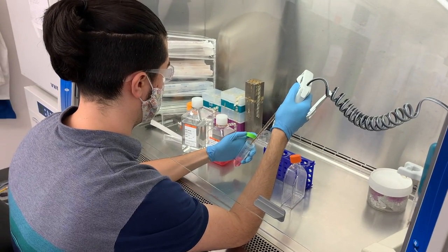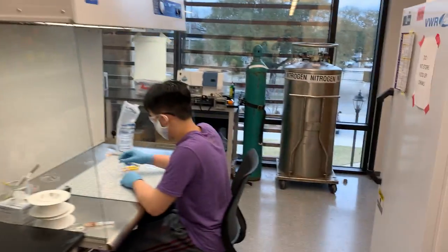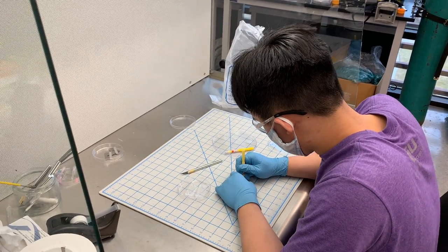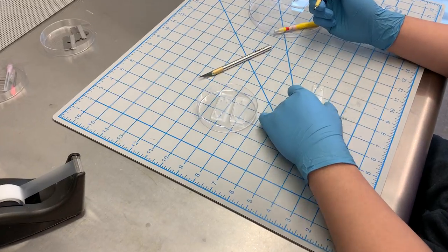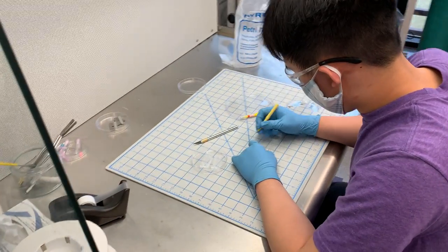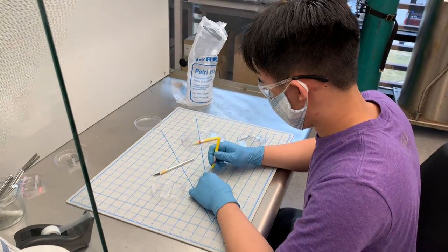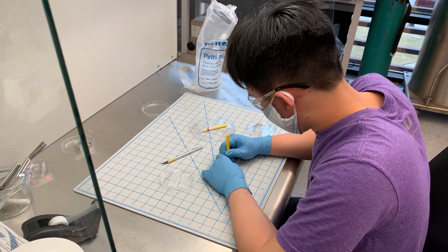We see Ali transferring some of those cells, which we culture in our incubators. Then we come over to Andrew, one of our undergraduate students. Andrew is working on a downstream step in the microfluidic device workflow — he's already made the silicon wafer and has produced what's called a PDMS replica, or polydimethylsiloxane — a flexible, transparent polymer. Andrew is cutting the holes used to connect it to tubing to make continuous flow systems. His device consists of three parallel channels to co-culture cancer cells and stromal cells, and is specifically designed to sample the media so we can look at how cells communicate with each other using proteins.